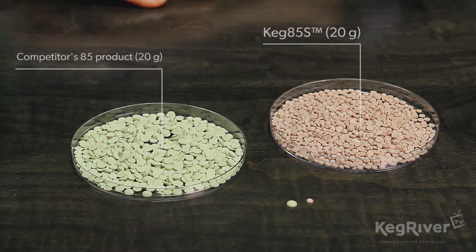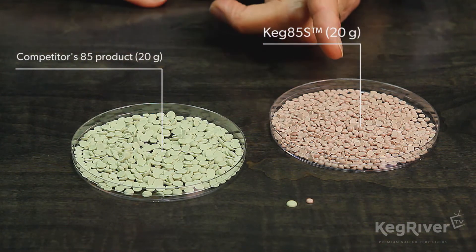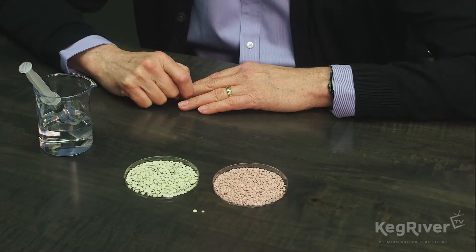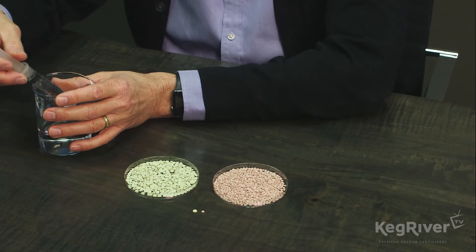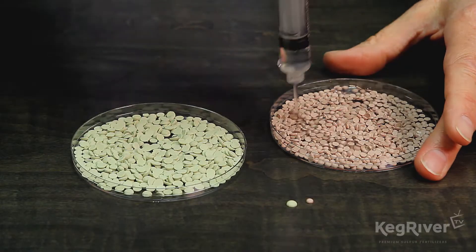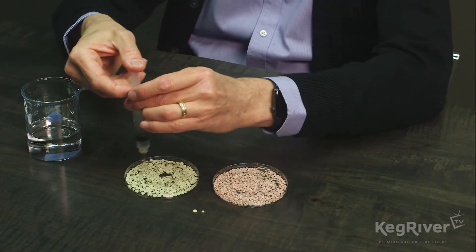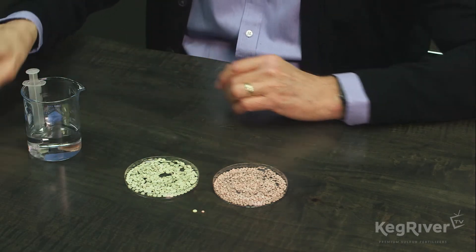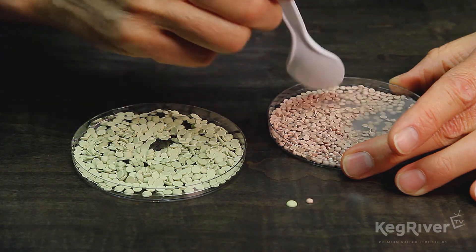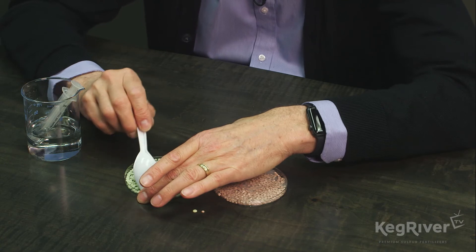Here we have a degradability demo between Keg 85 S, which is the brown one, and a competitor sample that I got just recently. We measured out 20 grams of each sample, then added 10 cc's of water to each, trying to get them all wet if possible, and then let the product degrade for 24 hours.